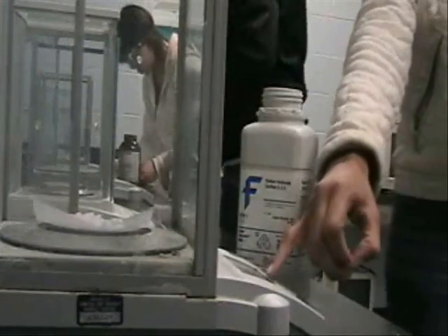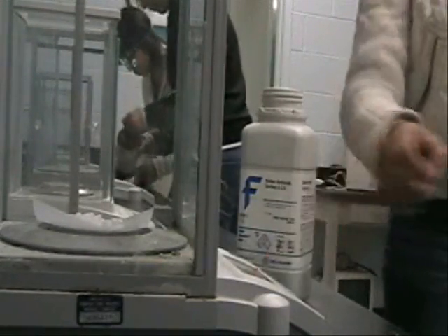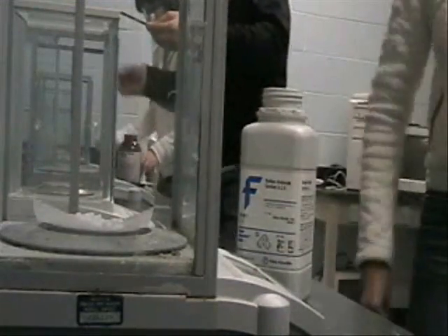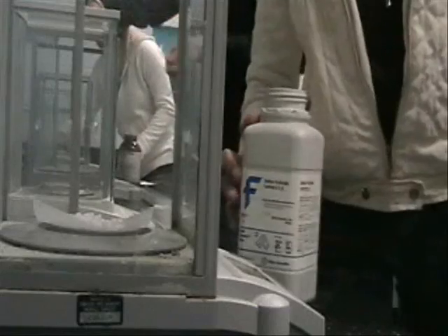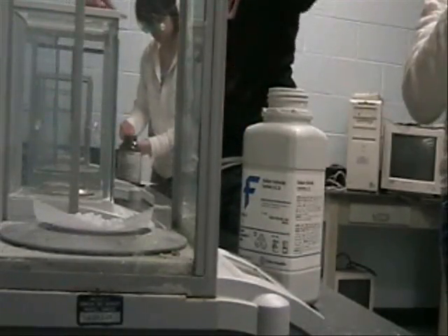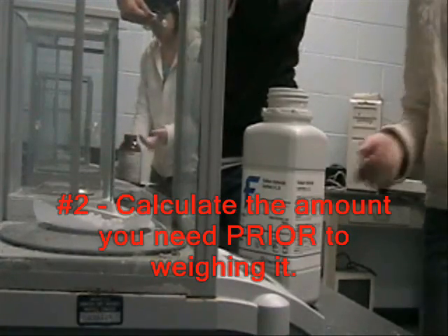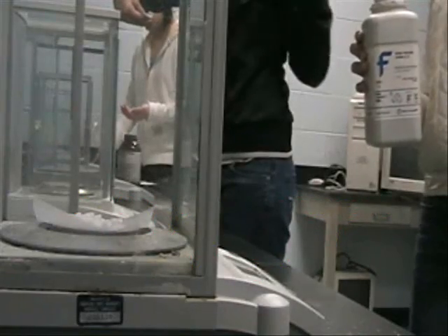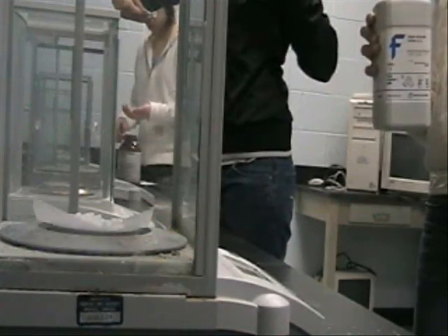Take this off and see — look, it's 11-98-68. Where did you get 12 from? It's 4 grams per milliliter. We need to make 300. You dilute that. You make that and then dilute it. You don't add more than 4 grams.